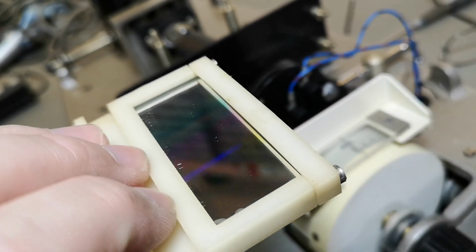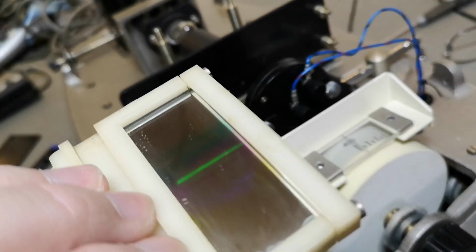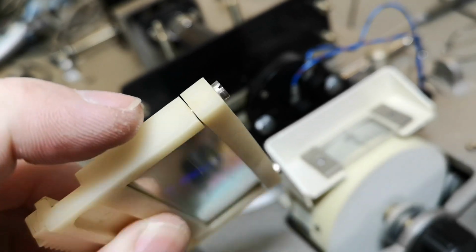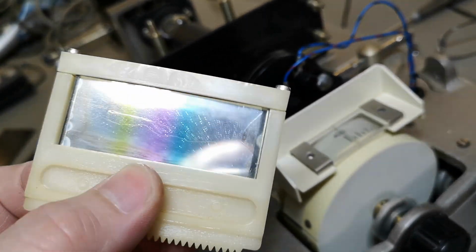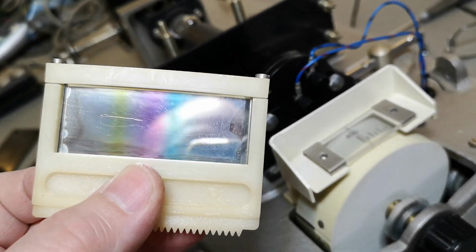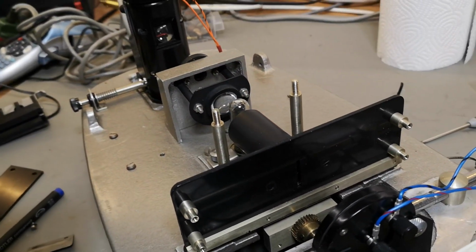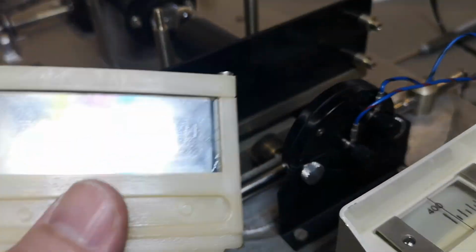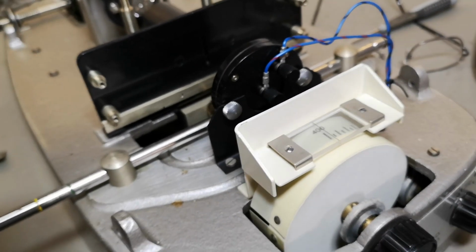Ooh, there's a funny line here. Okay, this is just light. How the heck is this made? I don't dare to open it here, and it's probably going to fall to pieces. There's many layers of funny stuff in this one, and it will be real stupid to break it, because now the whole thing really works, and it is super, super cool and funny, this unit. So I definitely want to put it back and have it working.